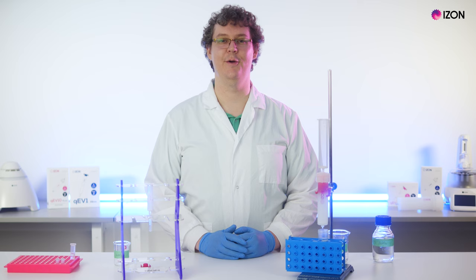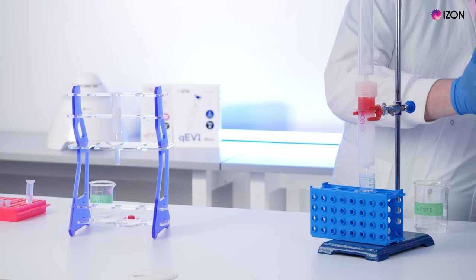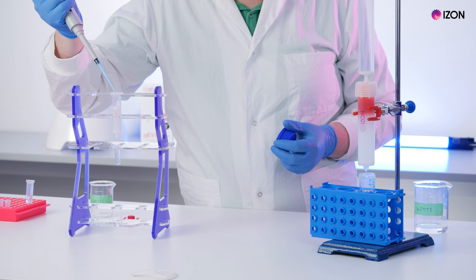Once your collection vessel is loaded, pipette the collection volume for the fraction you wish to collect into the top of the column or the buffer reservoir.